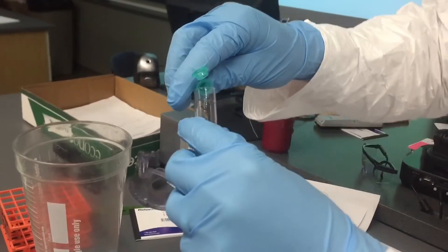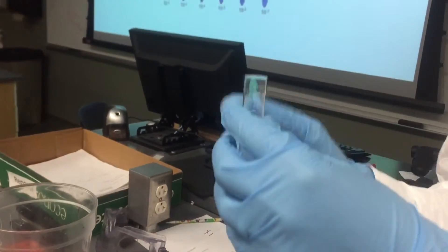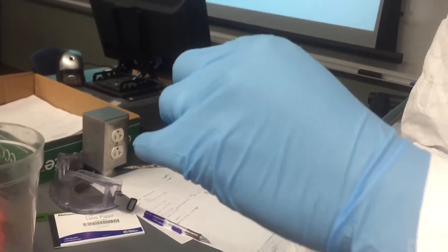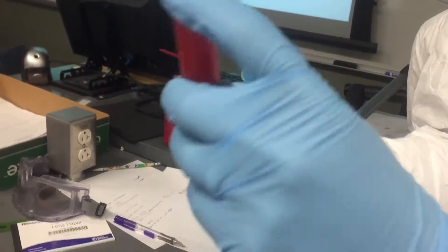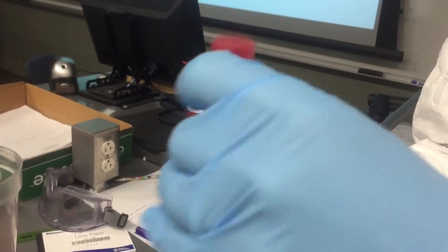So what is in here — E. coli, saline? No, this one — it's just soft agar. So it's like a dilute agar with some kind of firming agent. What is agar? It comes from seaweed — yeah, it's just agar. I was going to say it smells like a burned vegetable.